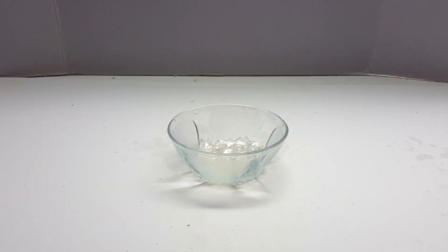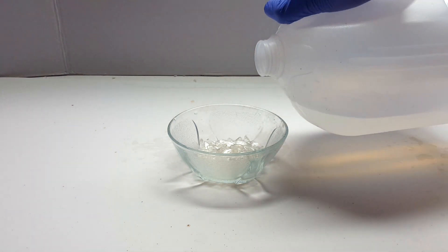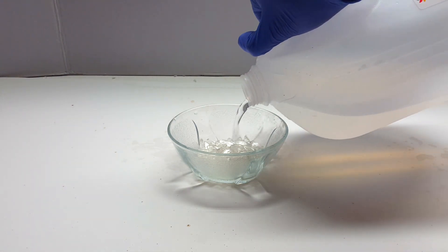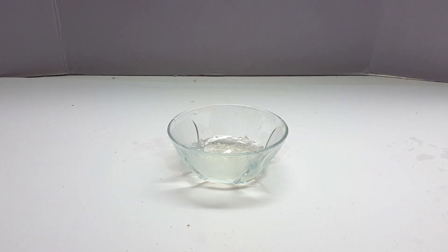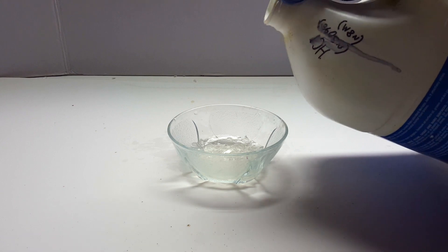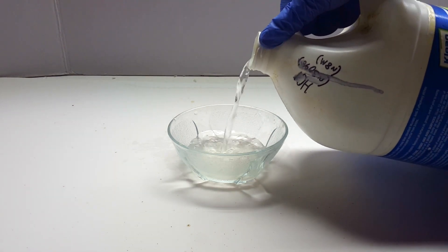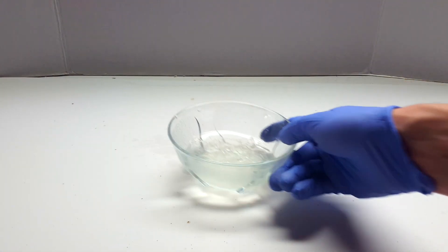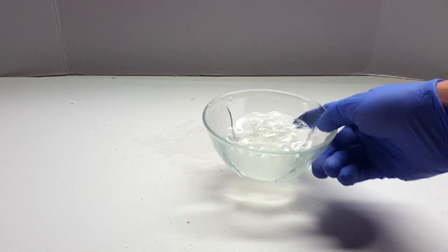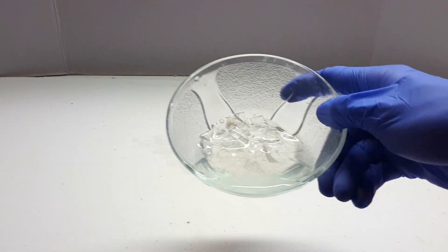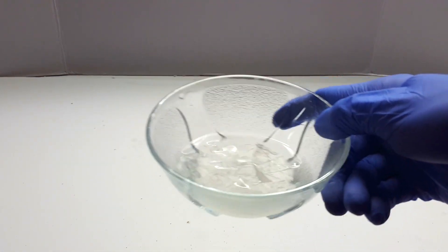Now if you happened to clean the broken glassware before you began with this, you now have your boiling stones. In my case, however, the glass was still relatively dirty, so I decided to give them a wash with acid. I covered most of the glass with some distilled water, and then added a small amount of hardware store muriatic acid. I gave the glass a bit of a mix, and you can see that the acid solution is visibly less brown colored from before the acid was added.